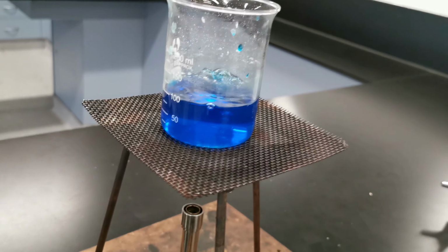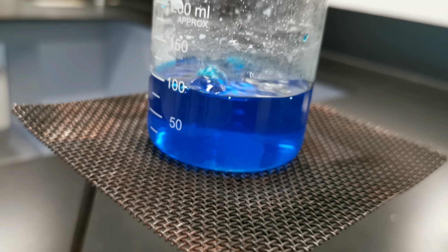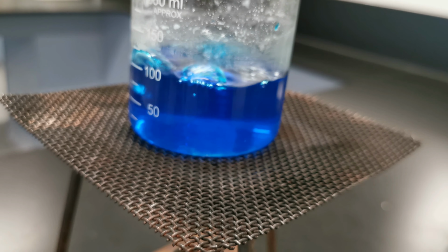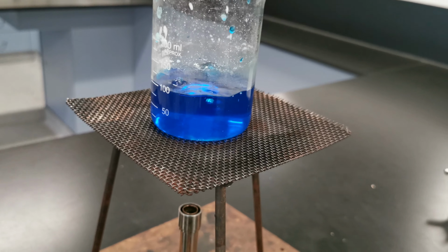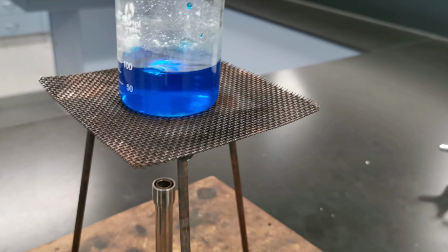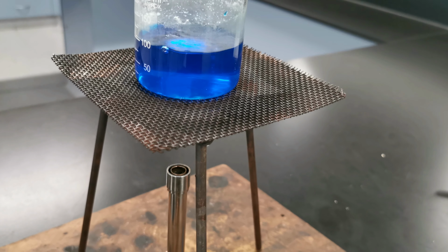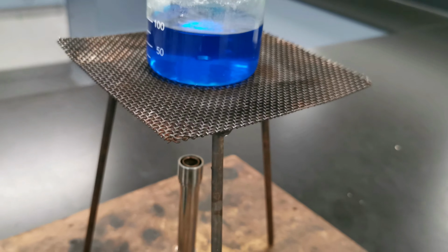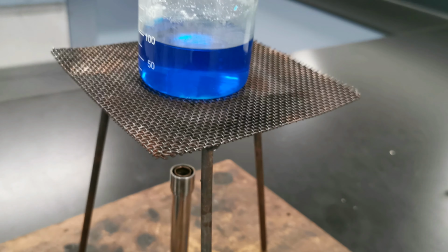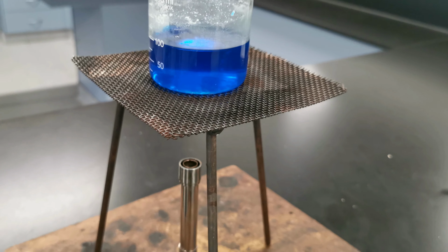So nice and hot, and we can see quite clearly that all of the copper sulfate has, in fact, dissolved. So that solution is fairly saturated. At 100 degrees, we can dissolve about 75 grams of copper sulfate, that's per 100 mils. I've got 75 mils, so I should be able to dissolve about 56 grams, and sure enough, I did. So it's a pretty saturated solution.